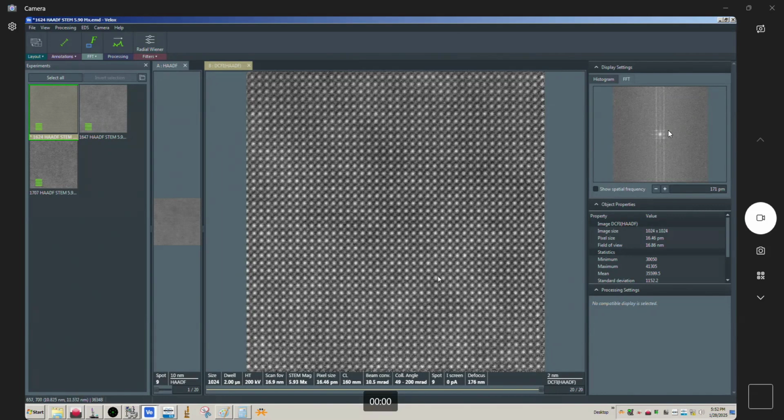And the reason for that is, right, if you have distortion between the images that's not uniform, it's going to be hard to add the frames together, right? You're going to get distortion in your STEM images whenever there's drift, okay? So in other words, your square lattice is not going to be a perfect square if there's some movement, okay? But if it's worse frame to frame, then you can imagine if you try to add those two frames together, it's not going to add together properly, and you're going to have maybe part of your image that looks kind of blurry. And that's exactly what we have here, okay?